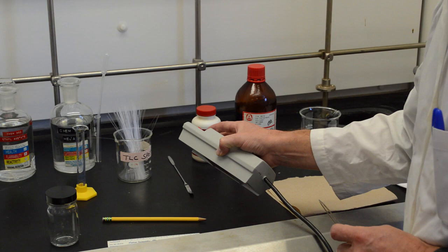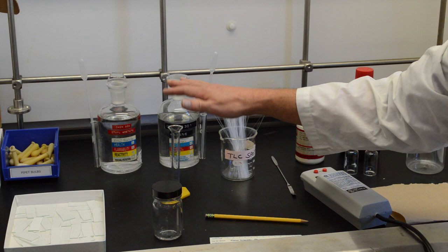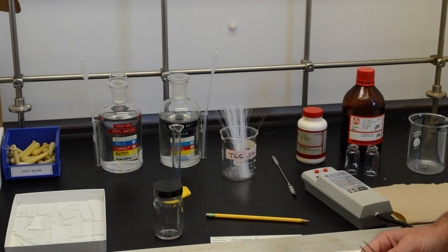There is always the question of the choice of solvent. So we have here ethyl acetate and hexane and a graduated cylinder and we will mix these solvents to a certain ratio which we will have to find out which is best for separating the compounds.